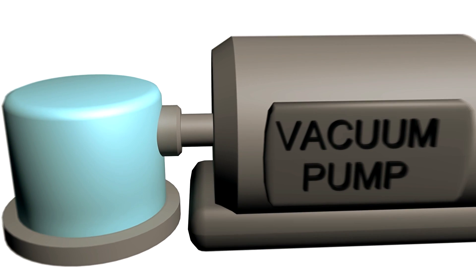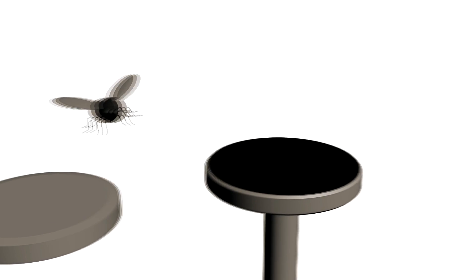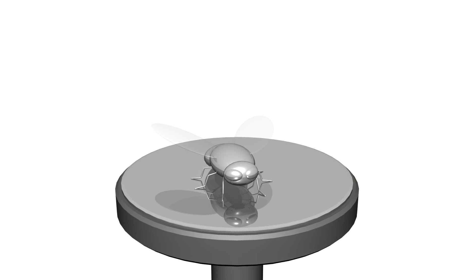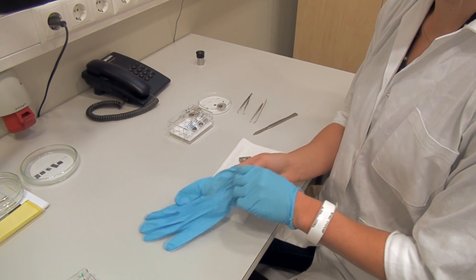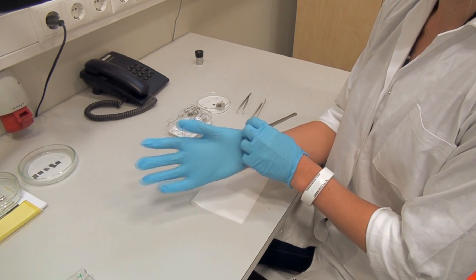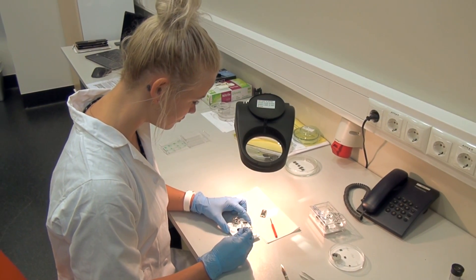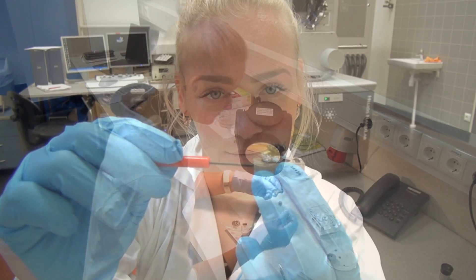So let's get started! We are dealing with a biological sample, and therefore it needs to be dried in vacuum and coated with a thin layer of platinum. The researcher has to use rubber gloves and pincers to avoid damaging or contaminating the delicate sample.